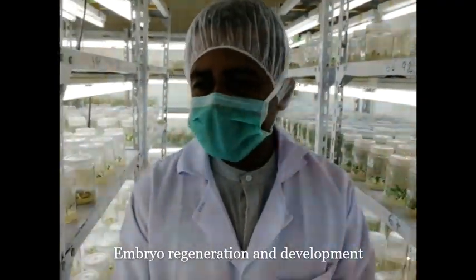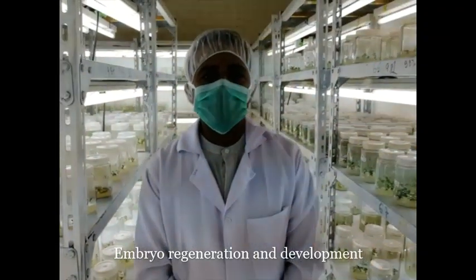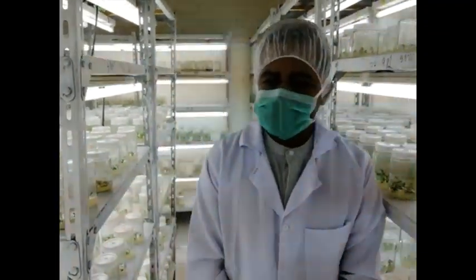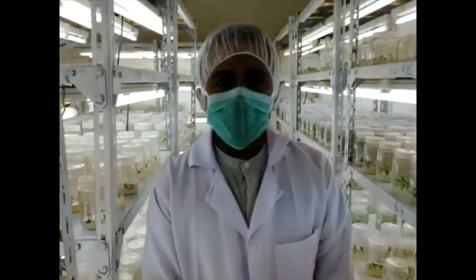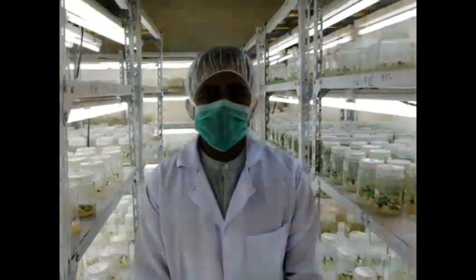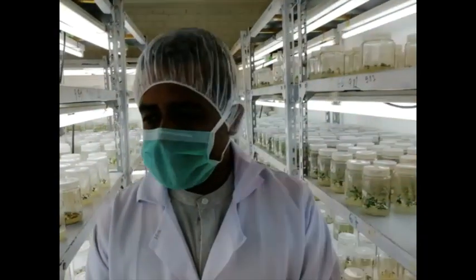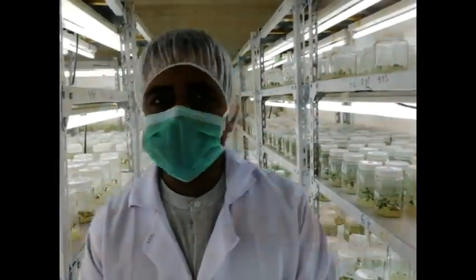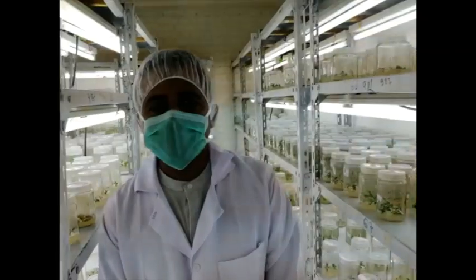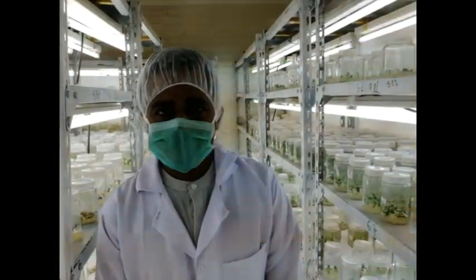I'm going to demonstrate the embryo regeneration and development step. In this step, from the previous step, we identified the embryogenic callus, and we take it and directly transfer it onto the regeneration media, skipping the tissue multiplication or proliferation step.